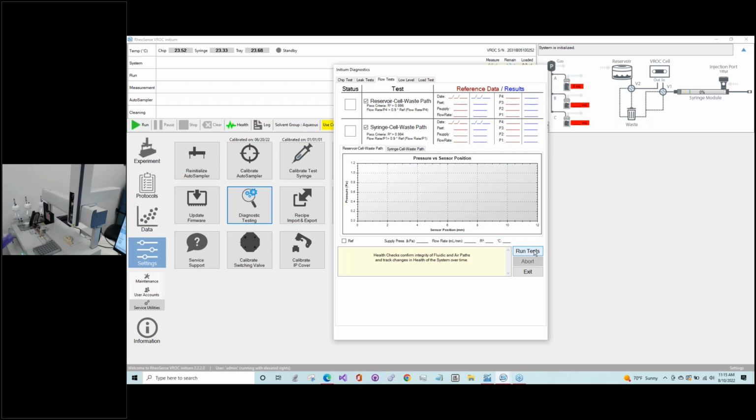We're looking for any obstructions here, and everyone knows that you could get them in the flow channel in the microfluidics, but there are some other popular places where things can get stuck if you have buildup of protein or any other type of solution where you could have buildup of residue. That would be the PEEK tubing coming out of the test syringe and the PEEK tubing entering the flow channel. Both of these tests will also confirm that your switch valves are moving to the proper position when they need to. Switch valves can also get clogged, so it's making sure that they're functioning as well. So that's making sure everything is flowing in all the necessary paths.